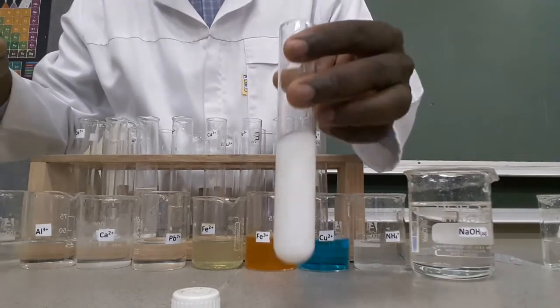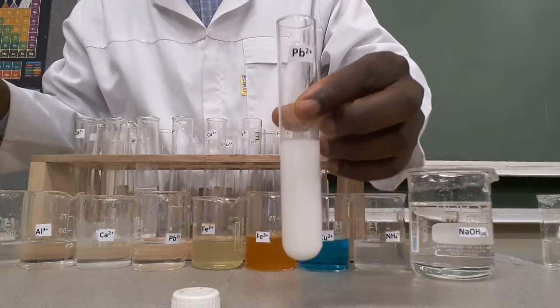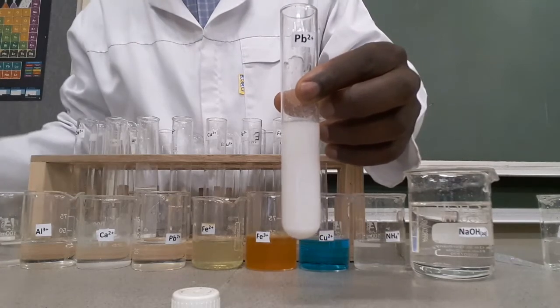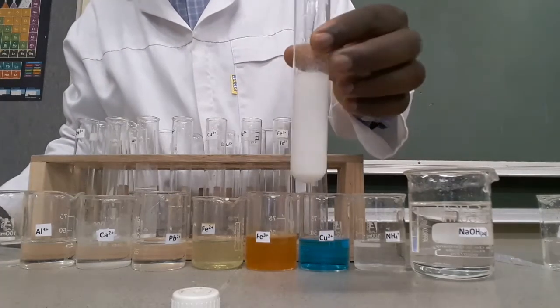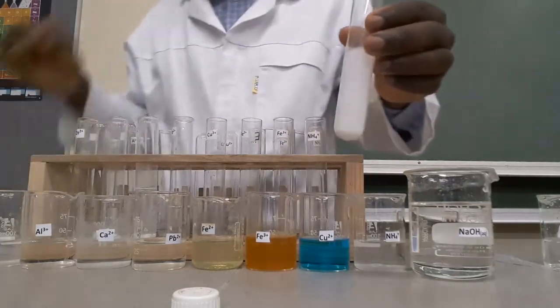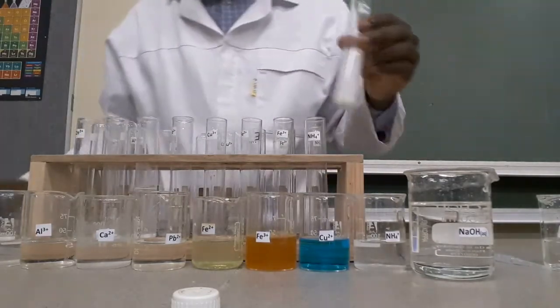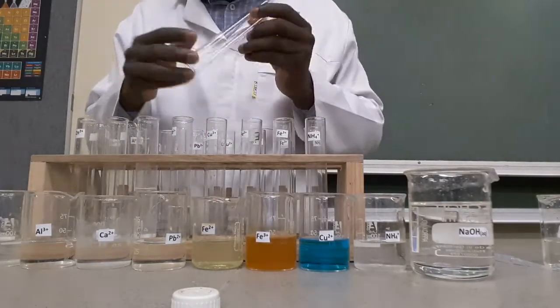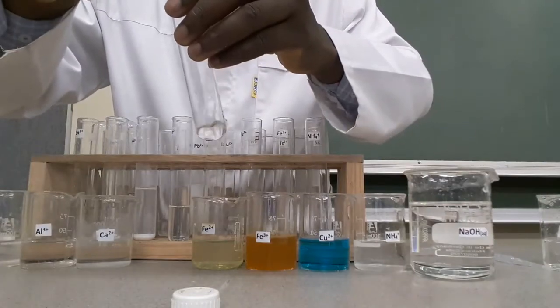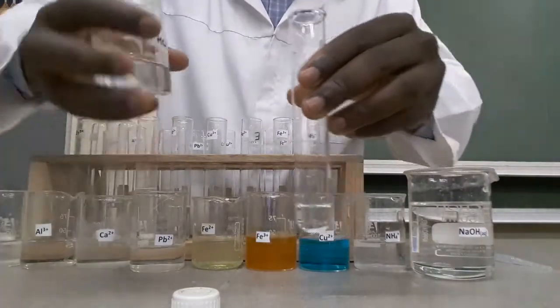Now we have two cations which give the same observation with both testing reagents — aqueous sodium hydroxide and aqueous ammonia. Lead ions and aluminium ions are giving us similar results, so another test should be performed to distinguish them. You can use dilute hydrochloric acid. Let's see the effect of dilute HCl on lead ions — add dilute HCl to the solution containing lead ions.